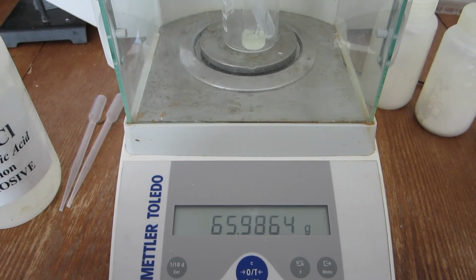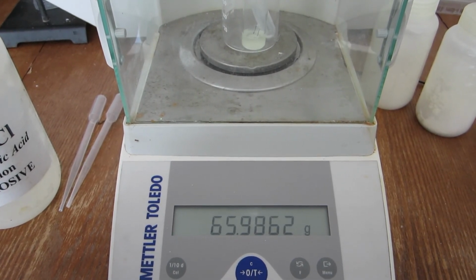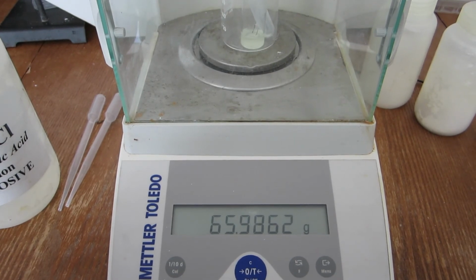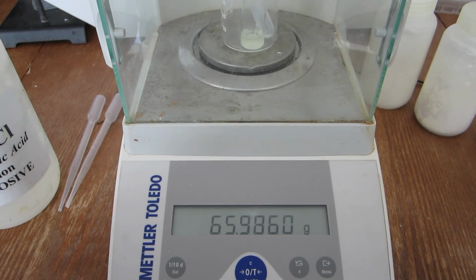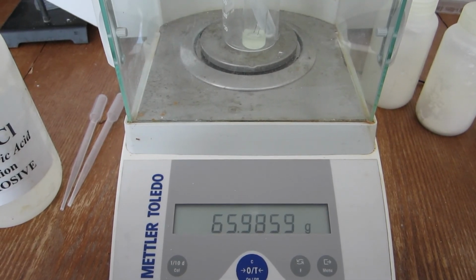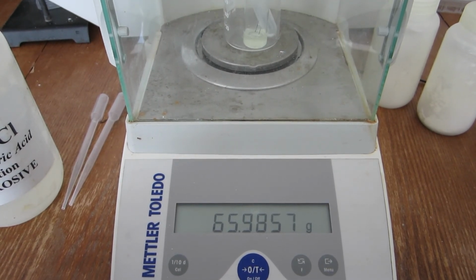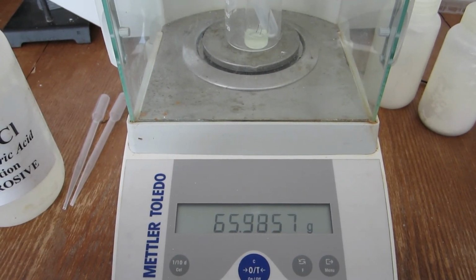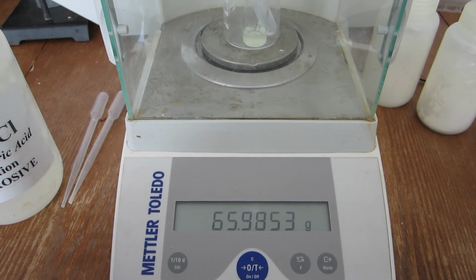With each trial now being completed, you can determine the mass of carbon dioxide lost for each trial, the mass of carbonate, and therefore the percentage of carbonate for each trial. After taking the average, you can determine the average percent carbonate and compare that to known samples, thereby identifying what this carbonate sample is.